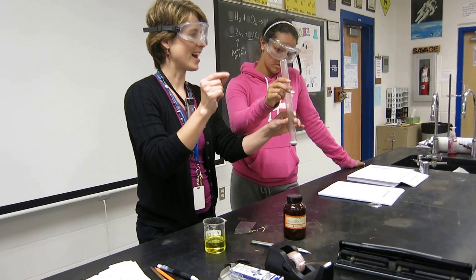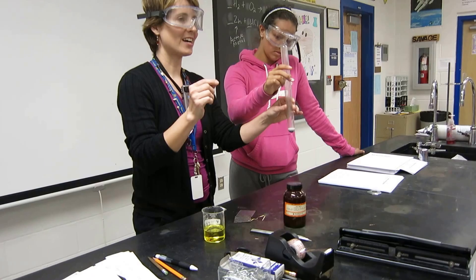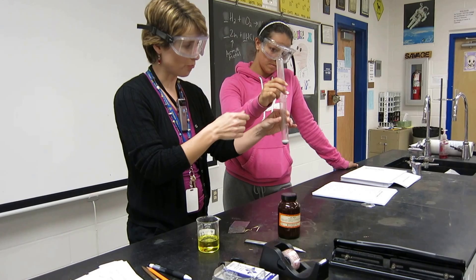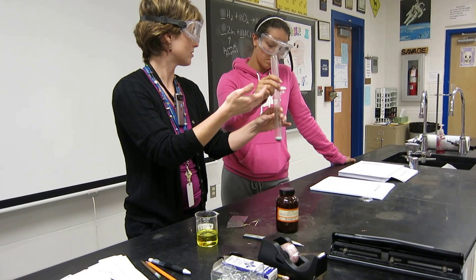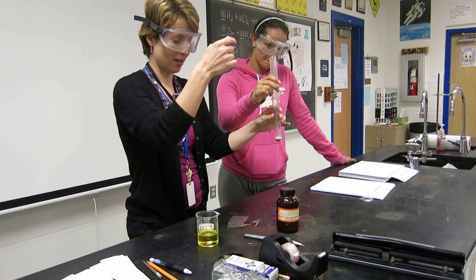To be hydrogen gas, you have to have two atoms of hydrogen coming together to make a gas molecule. So we've got a lot of hydrogen gas hopefully trapped in here. We kind of had it slightly vented to let out some of the old air that's in there, because it was not an empty test tube — it had air in it. But hydrogen is less dense, so it should float up to the top.